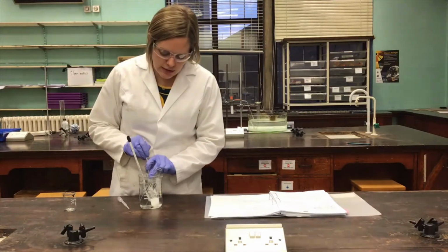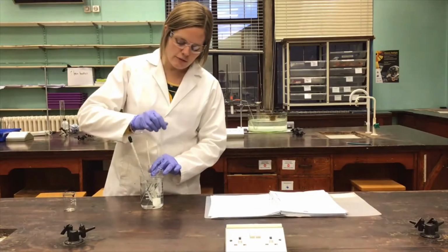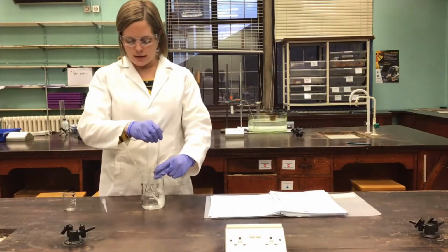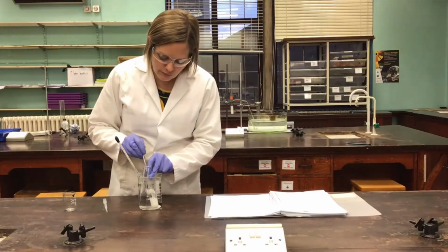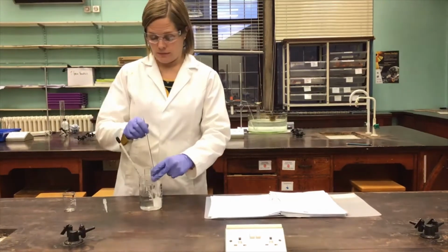And so I'm just going to take a stirring rod, a clean glass rod, and carefully stir this, being really cautious not to break the boiling tube as I go. Adding just gradually some of that ethanol solvent to try to get this crude aspirin to dissolve. That's going to take a few goes, I think, so we'll come back in a few minutes.